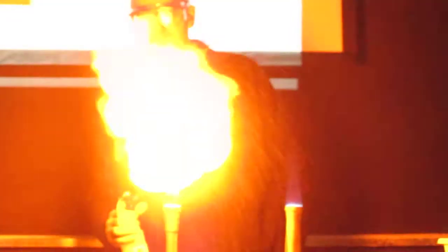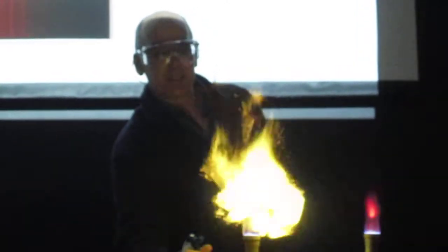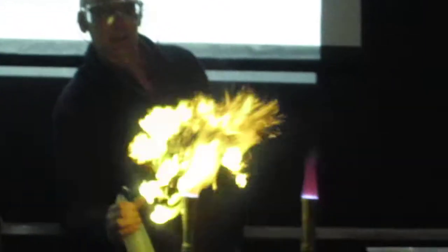The sodium, and you know the sodium light, I should just point it, I'm going to bring it out. And barium, as you see, has not too many lights in the red domain, but it's more in greenish. And ooh, it's the prettiest.